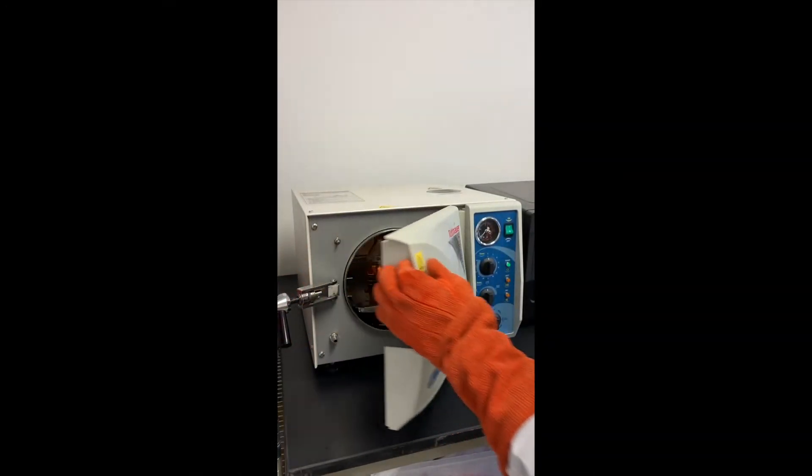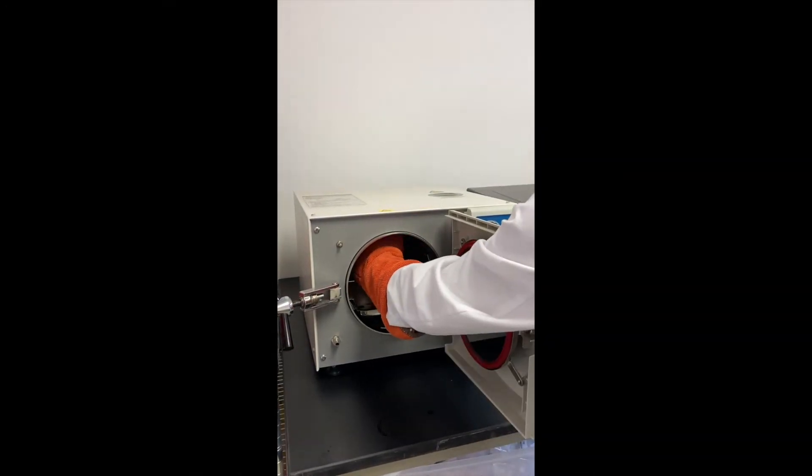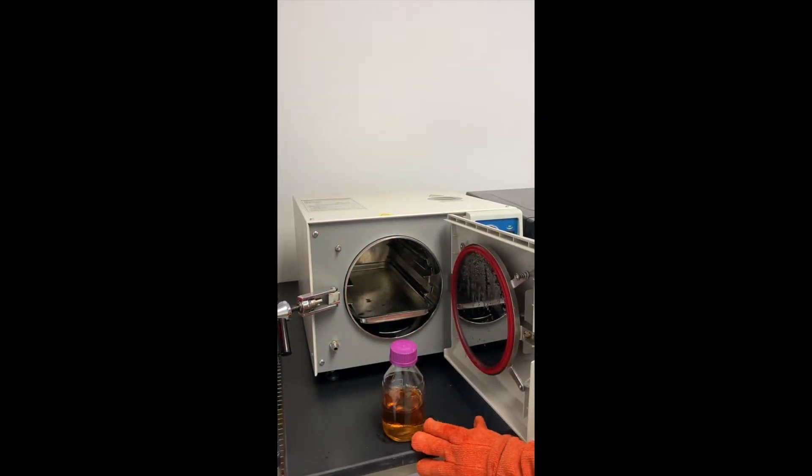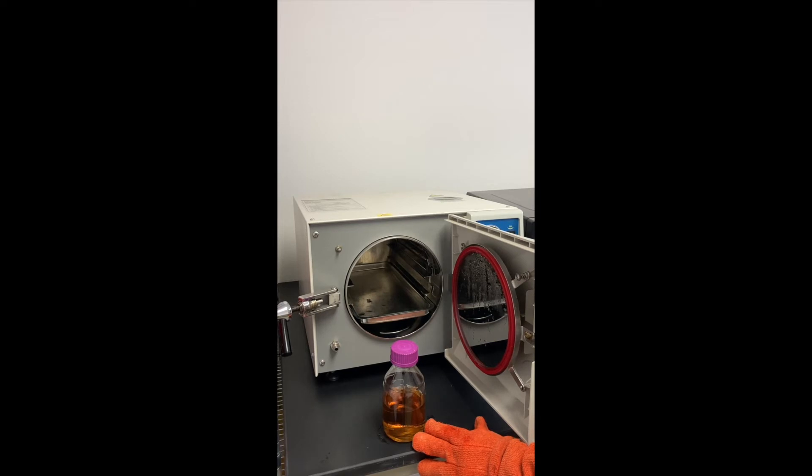After the LB agar comes out of the autoclave, it is a sterile, hot liquid. We want to let it cool down until it is comfortable to touch before we add the antibiotic. If it is too hot, it will break down the antibiotic.